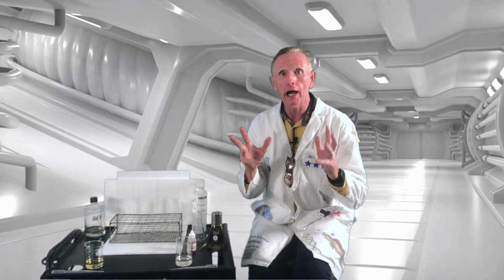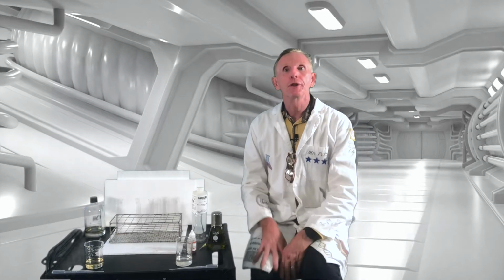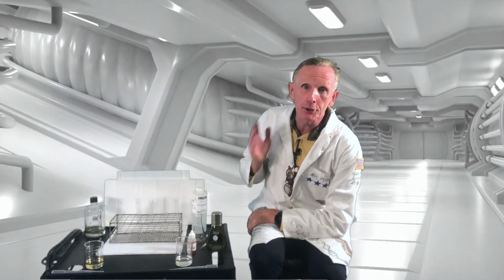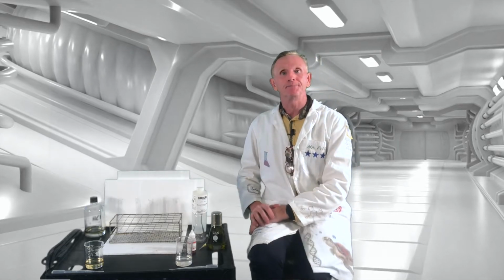Welcome to our hazardous waste, or at least the waste chapter virtual lab. With this one, you're going to fill out a typical design your own experiment. Of course, I'm going to run the experiment here, and you can fill out the paperwork there. Your question: what happens when a strong acid interacts with a strong base?